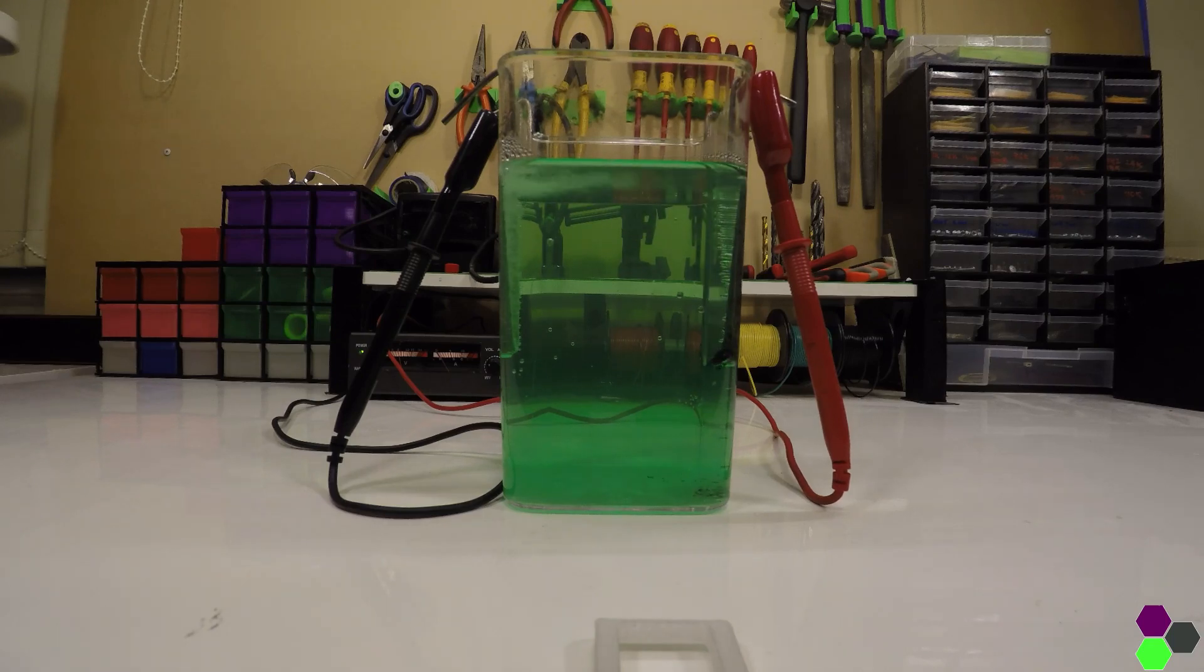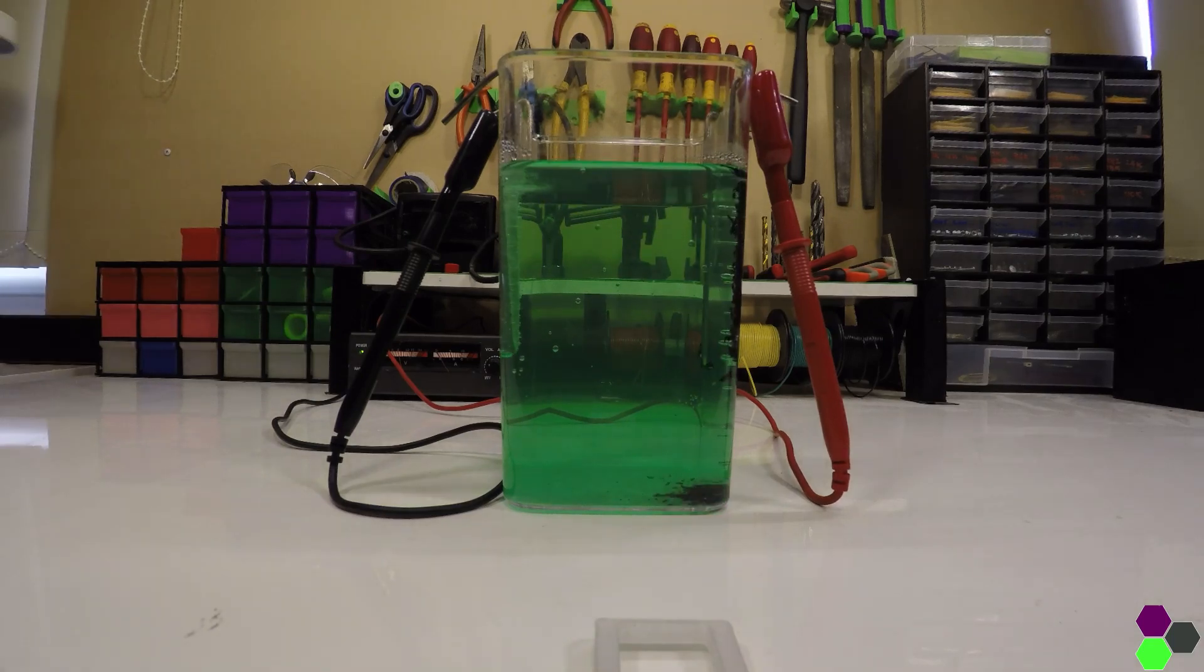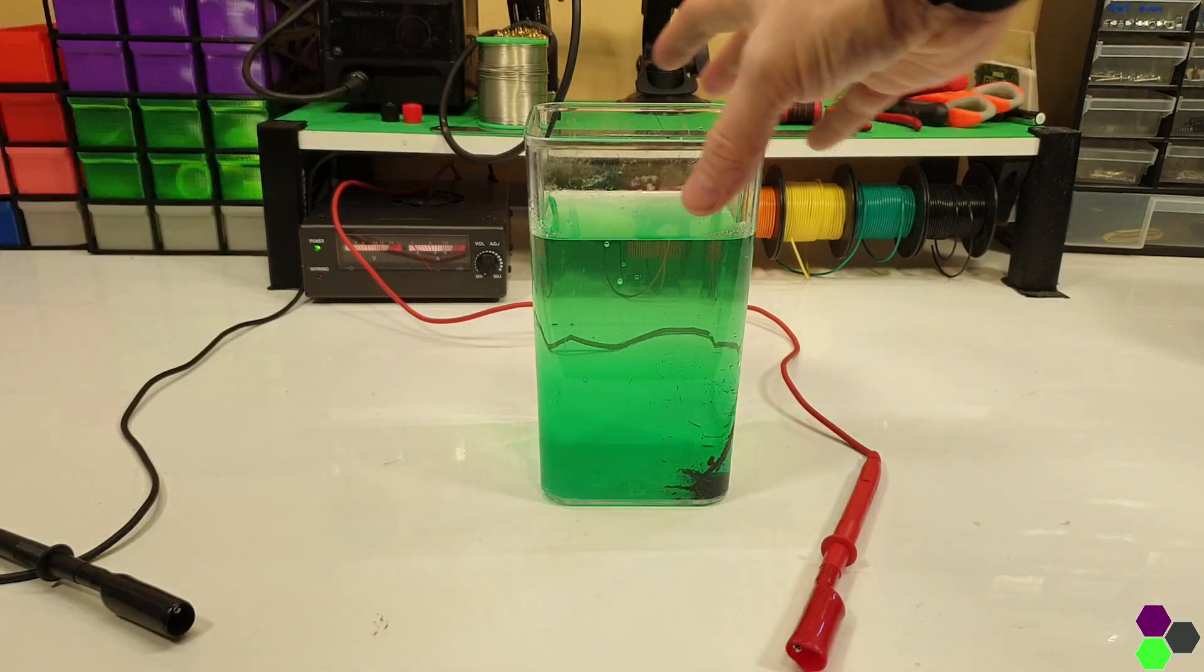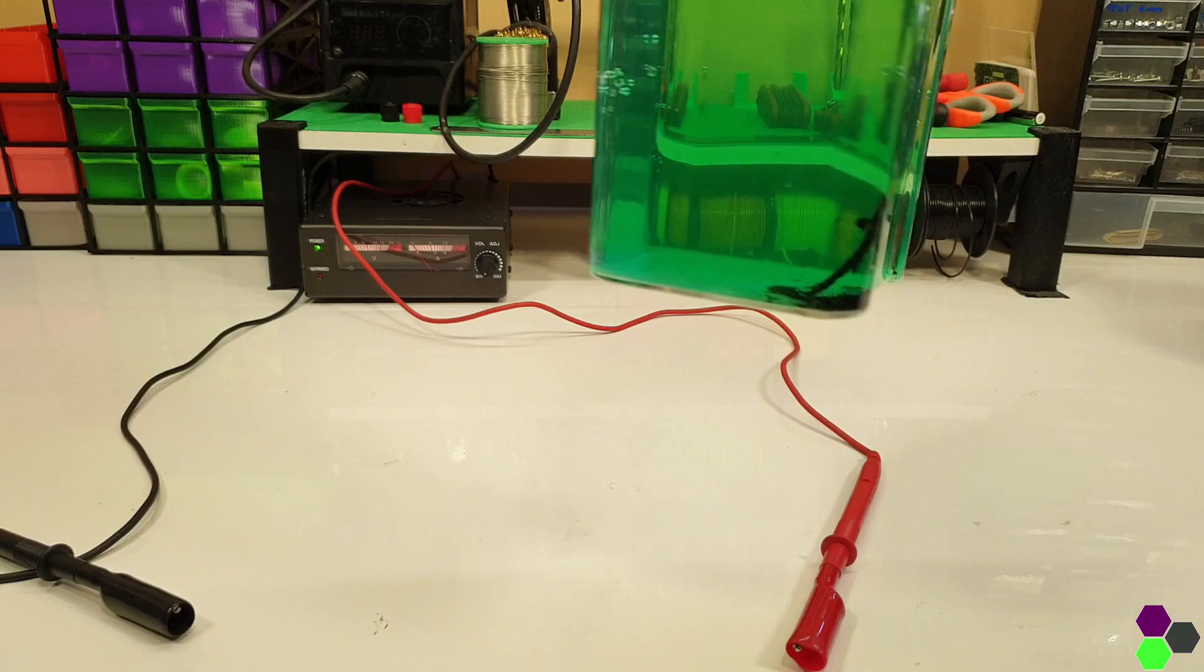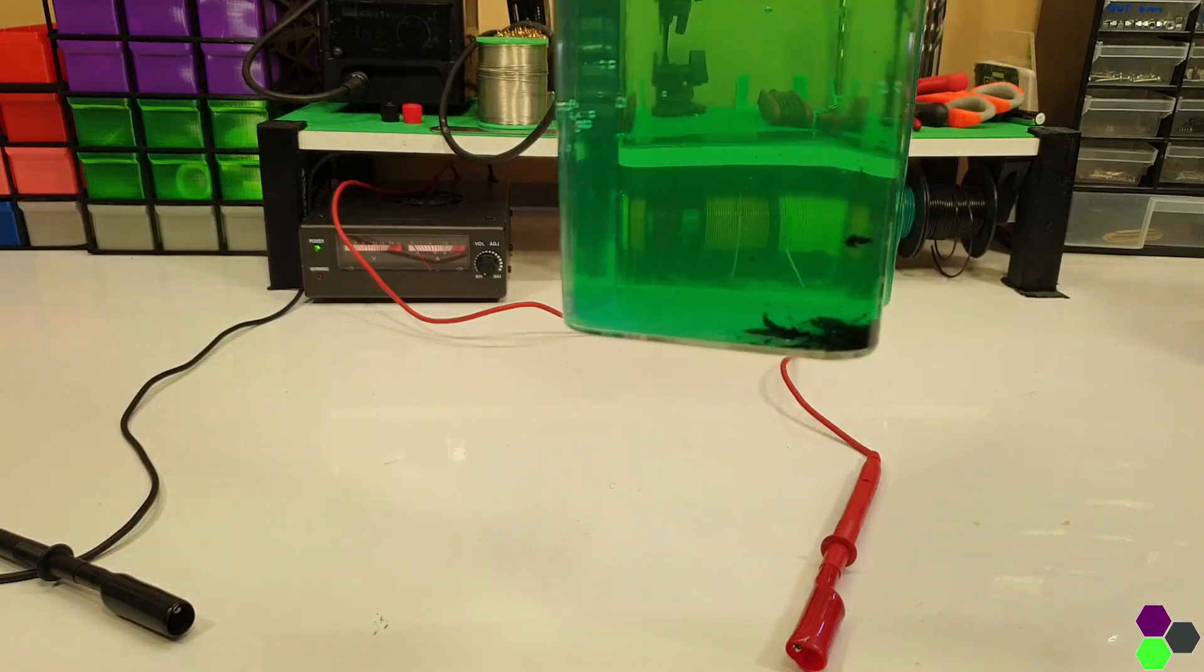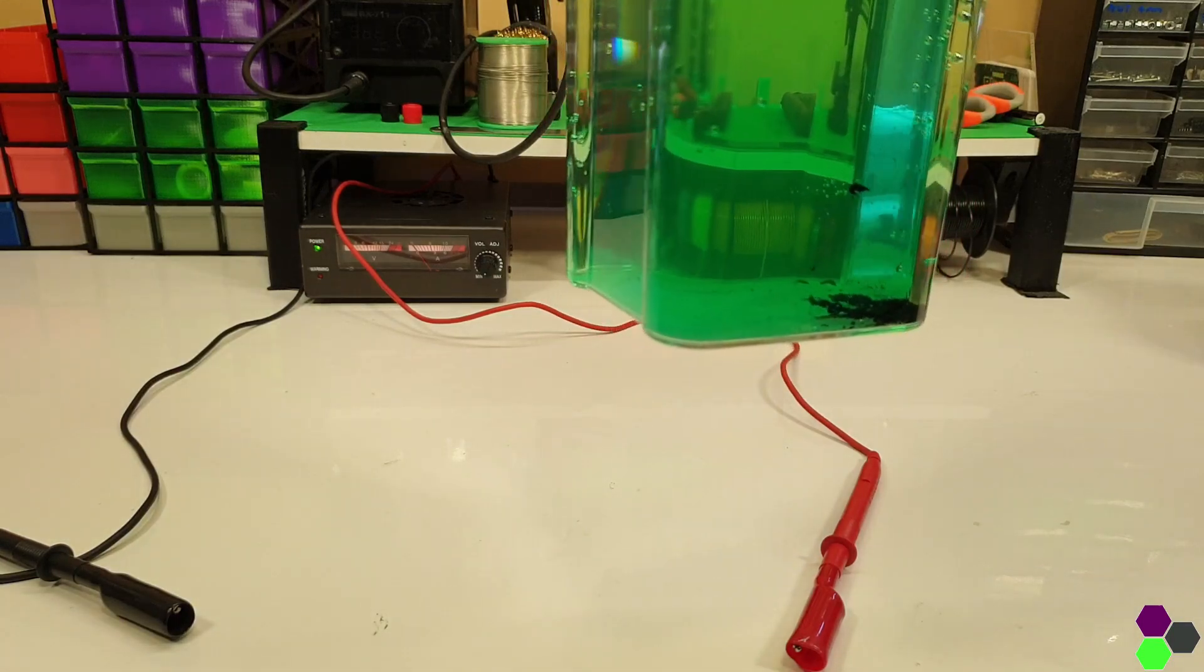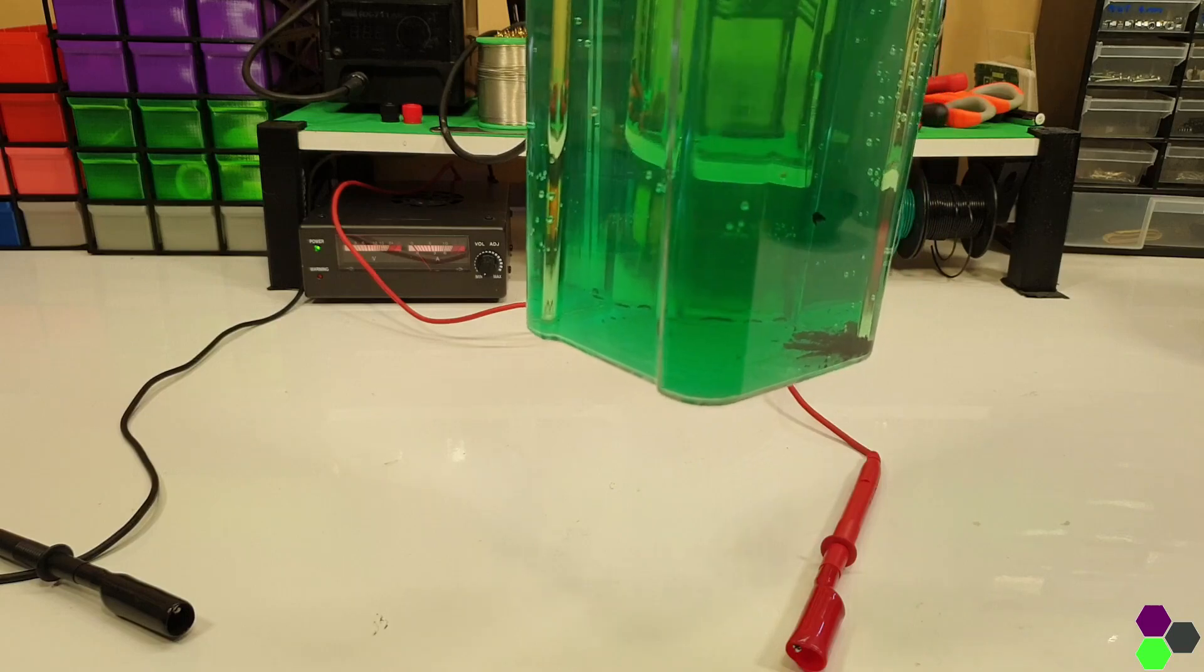I do occasionally filter my electrolytes with some cloth just to remove some of the debris that's built up over time. Here you can see my finished nickel acetate electrolyte. There's some undissolved debris in the bottom, I'll filter that out before using it but that's not overly necessary.